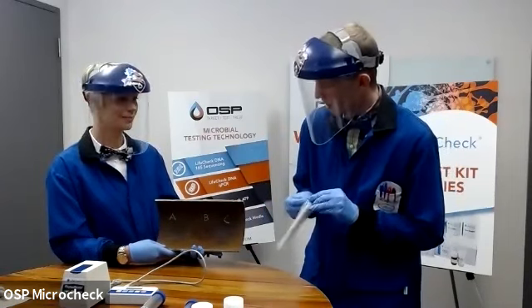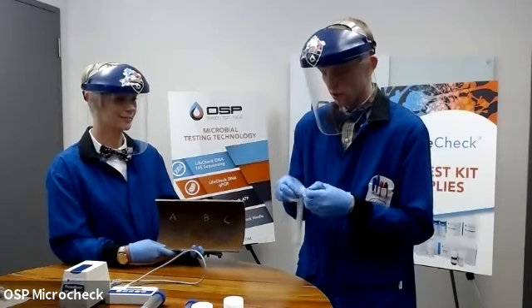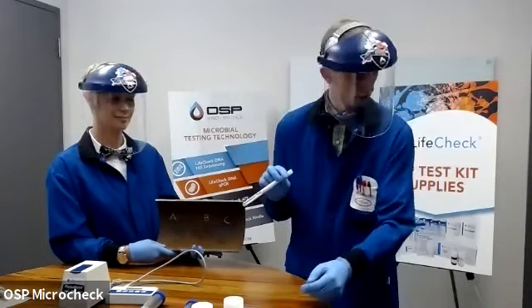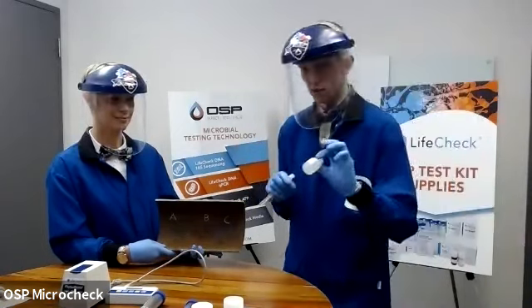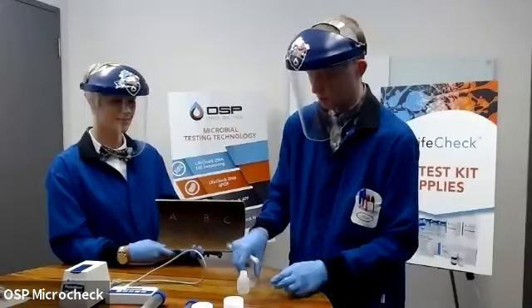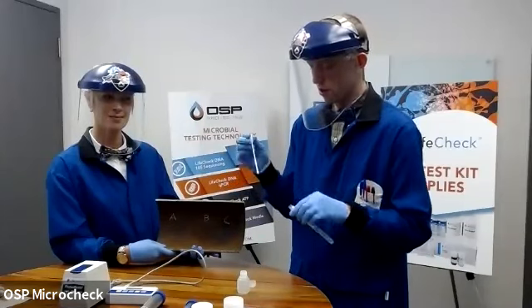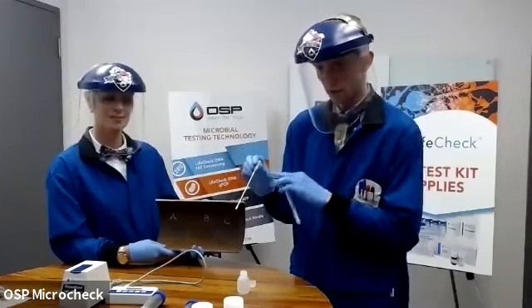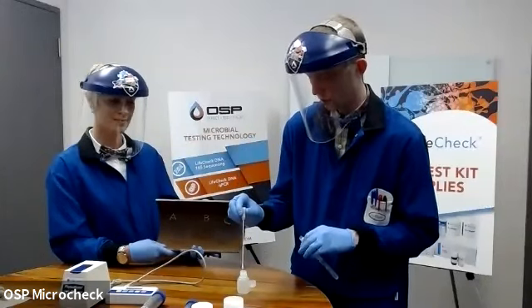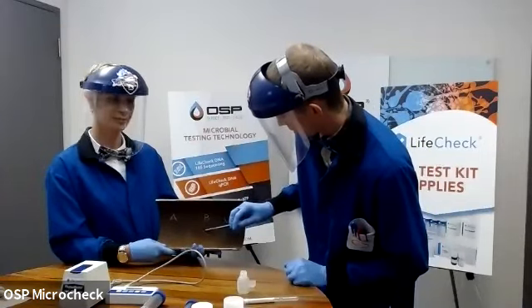But backing up a few steps, to conduct ATP testing on the surface, you can get a surface testing kit from us that comes with swabs, sterile swabs, and a soak reagent. So this agent is used to wet the swab. So a sterile swab that I'm taking out of the tube. Be careful not to touch any other parts. And this is only going to be immersed in this soak reagent one time, because I don't want to cross-contaminate it. And then I'm simply going to swab the surface area of my pit.